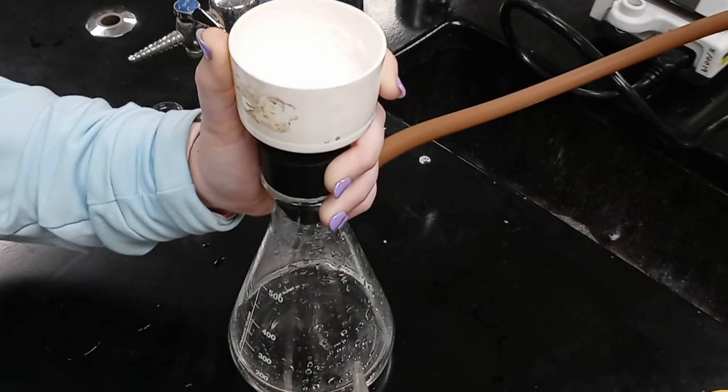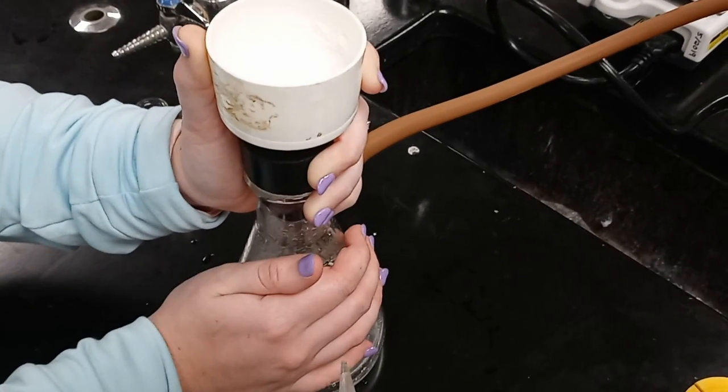IR was also used, however, due to a lack of understanding from the user, this value was disregarded.